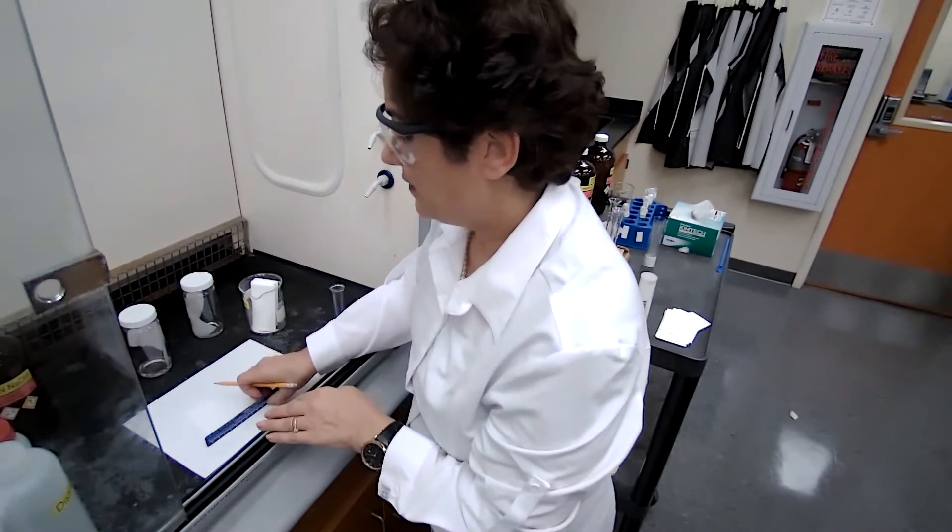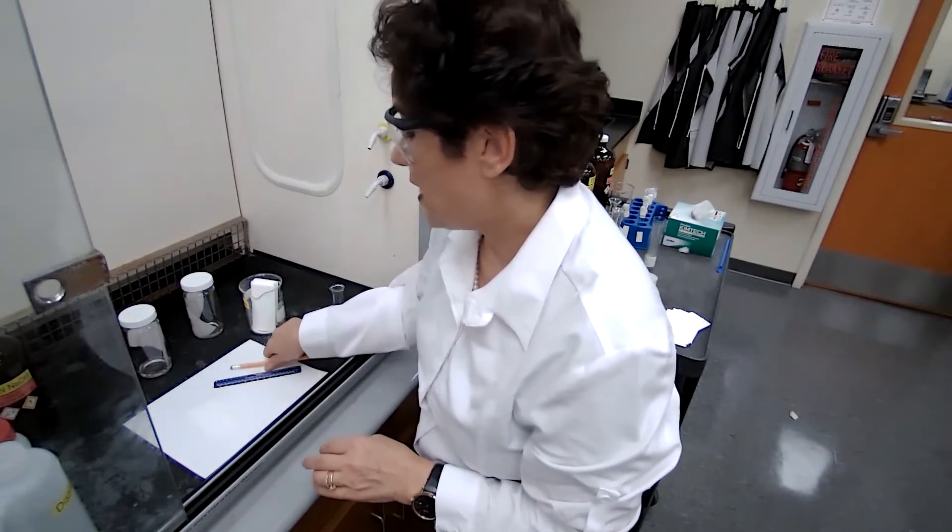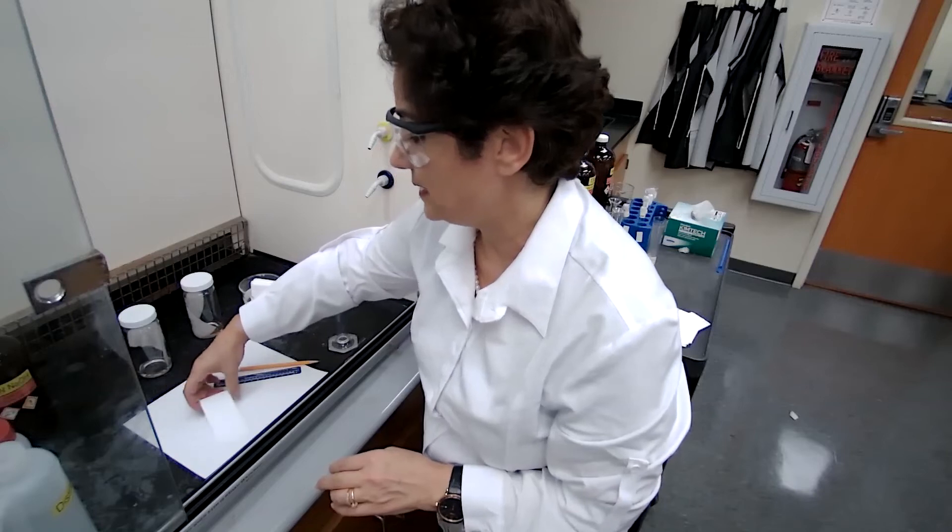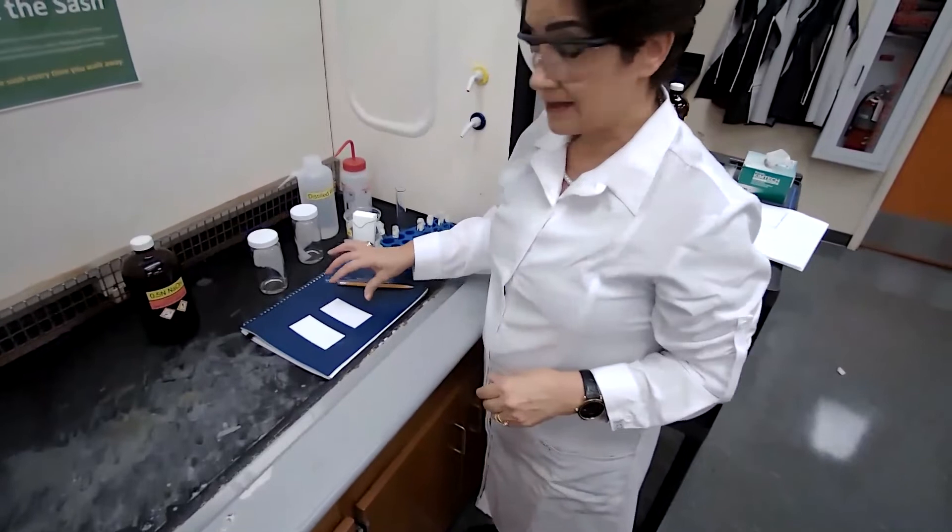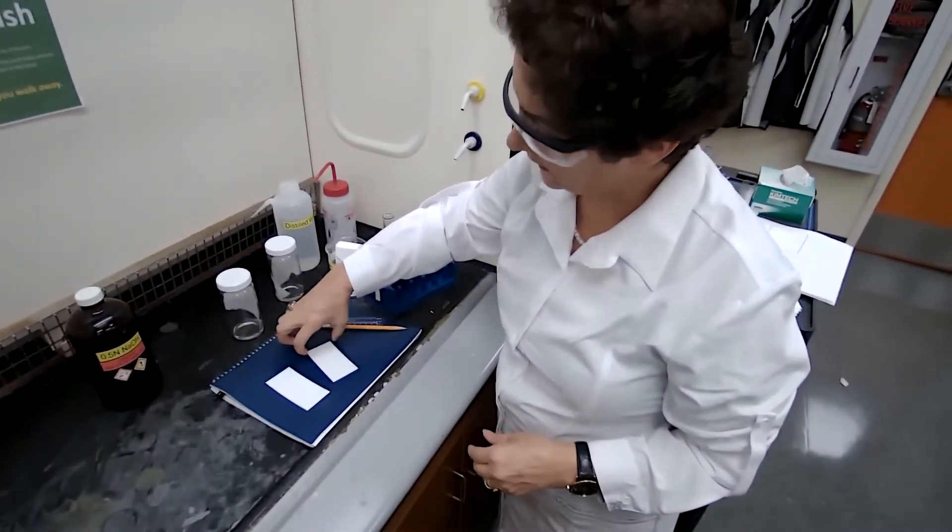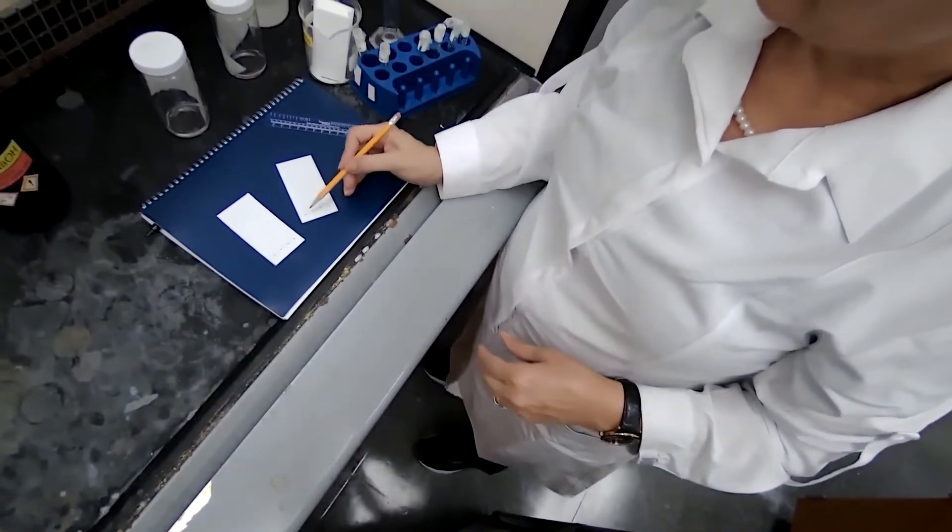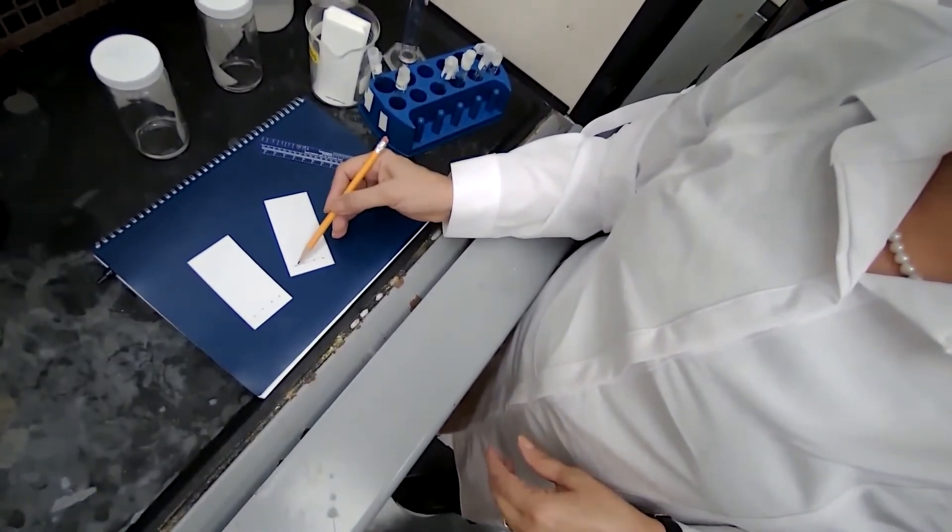I will follow the exact same diagram I have on my paper. So I have the TLC plate, I draw the line, and I made four dots here where those are the places for my sample.